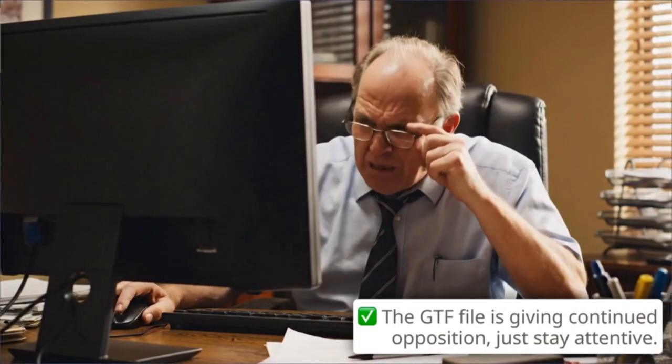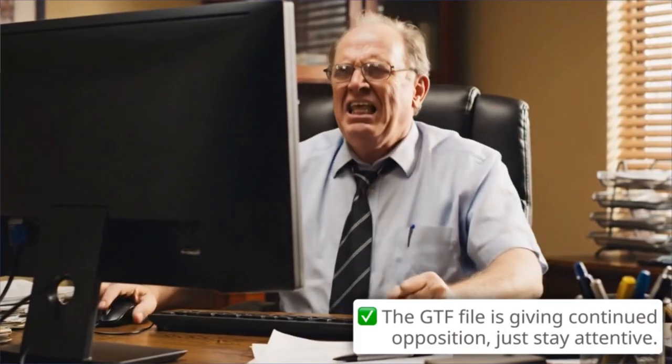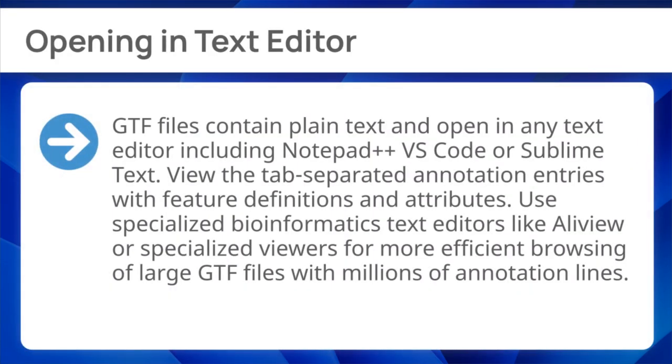Before we proceed to the guaranteed fix, let's clarify the why. Here are the top technical explanations for the persistent GTF file error. First, opening in text editor. GTF files contain plain text and open in any text editor, including Notepad++, VS Code, or Sublime Text. View the tab-separated annotation entries with feature definitions and attributes.